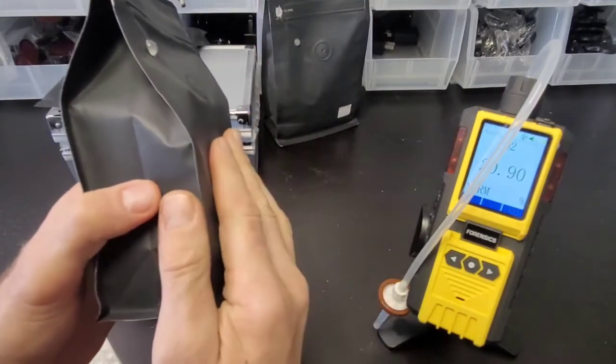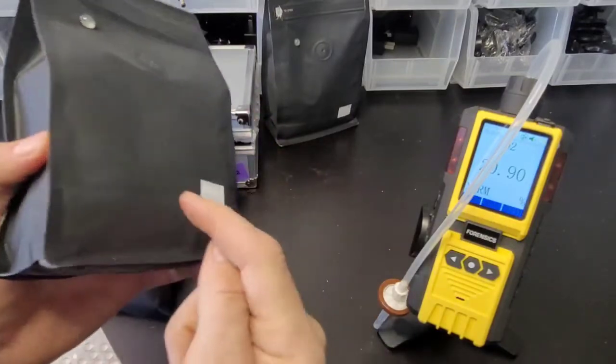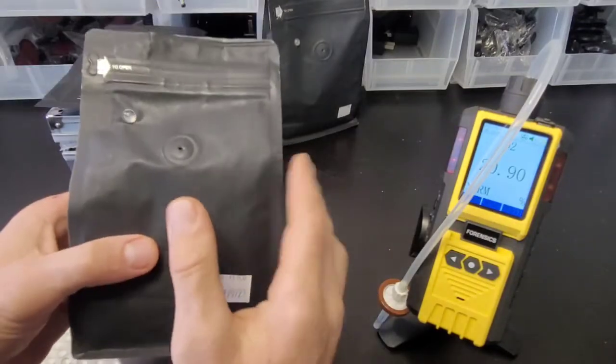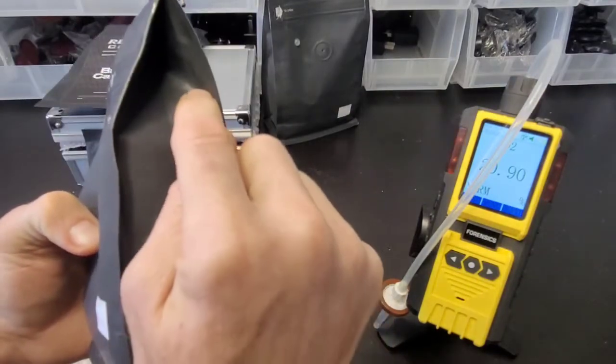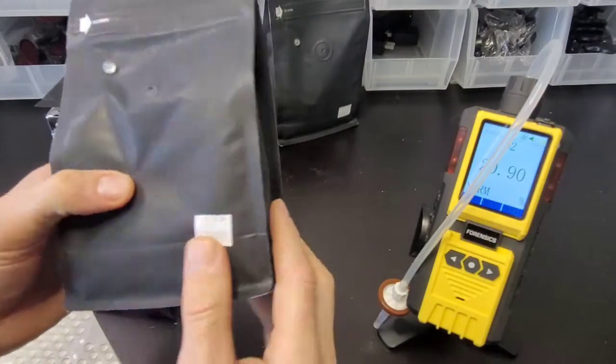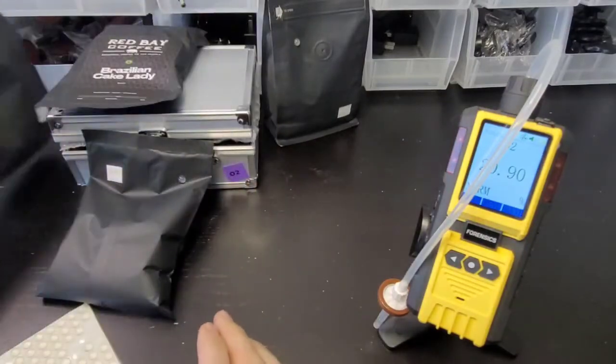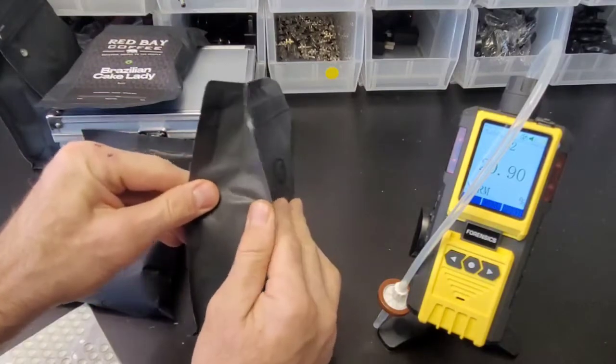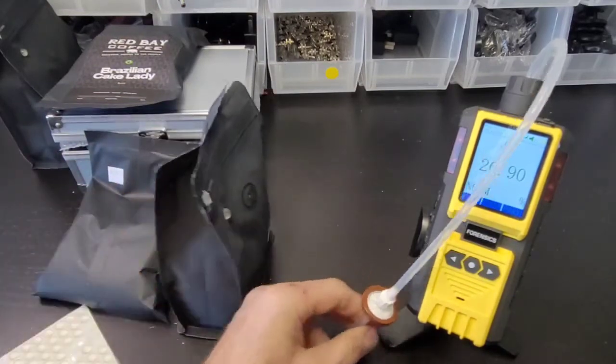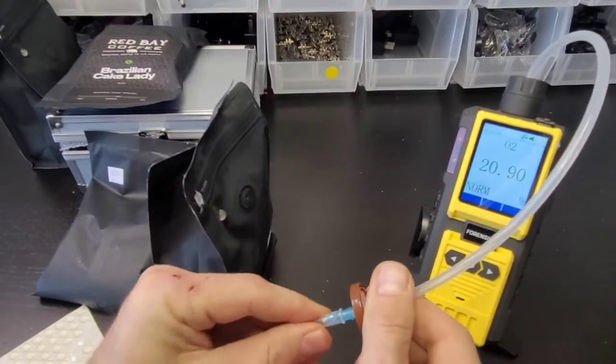We're confirming there's no holes in the package, otherwise that would be reading much higher than 8%. I've seen some packages with tears and small microscopic holes, so be careful when you're analyzing your packaging to figure out where air is coming in from.